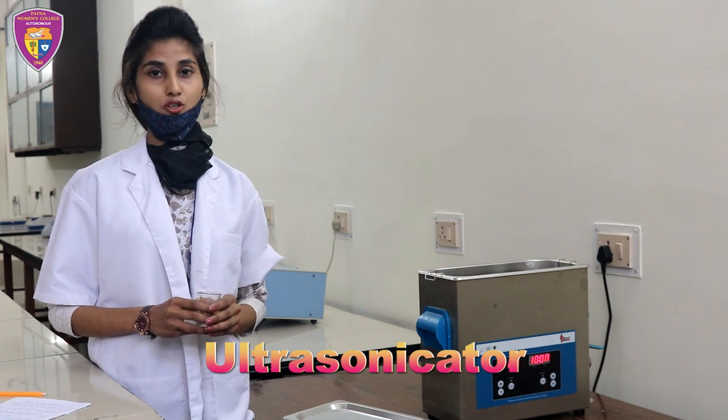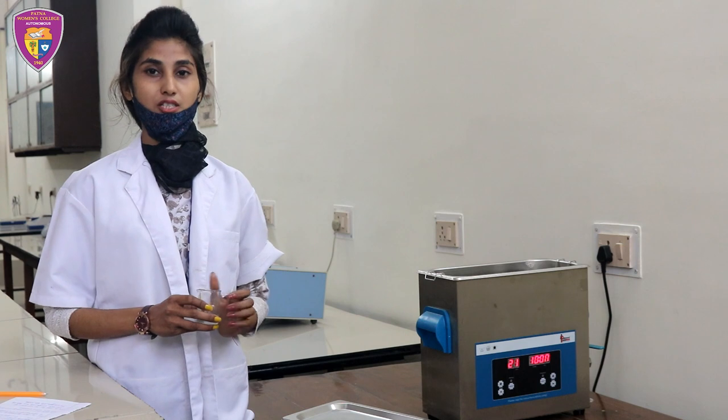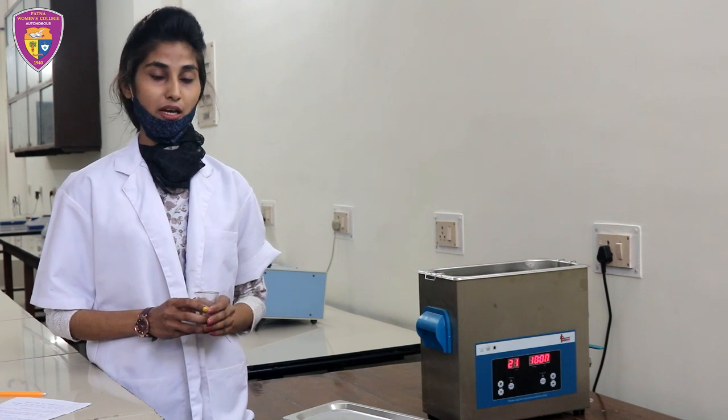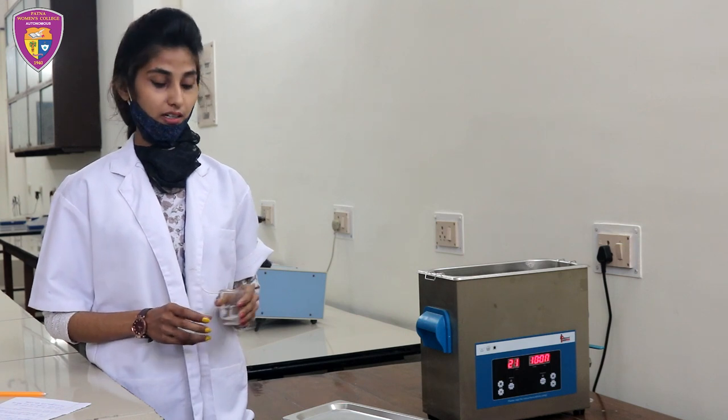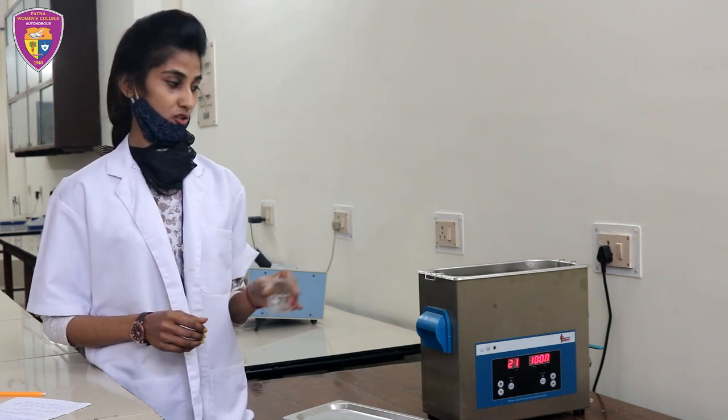An ultrasonicator is a machine widely used in the laboratory. It applies sonic energy to extract multiple compounds from plants, seaweeds and microalgae. Right now I am testing this sample via the ultrasonicator.